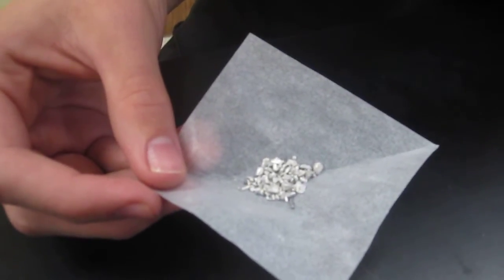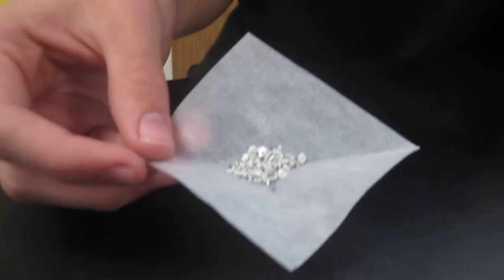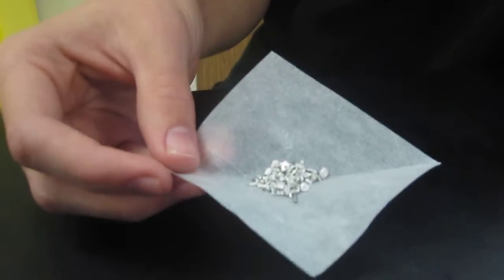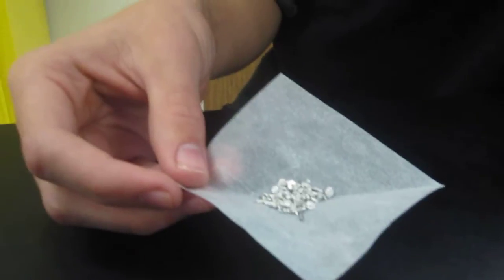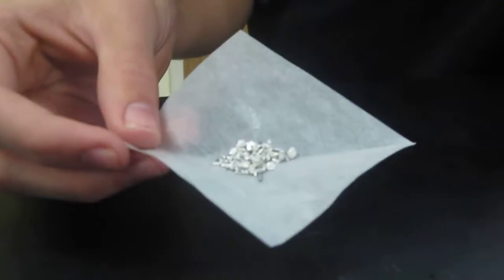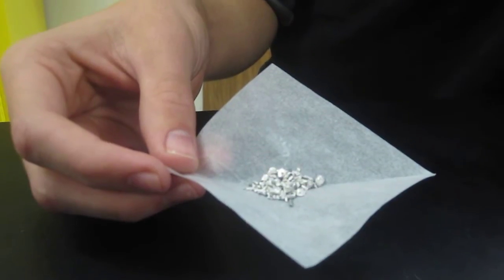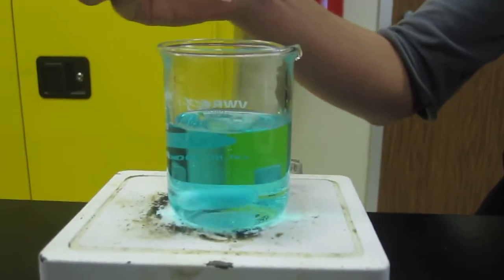That's a very unstable magnesium, of course, because it's magnesium metal and we all know magnesium would prefer to be in the plus two oxidation state. So let's see what happens when that reactive magnesium metal comes into contact with this copper solution.